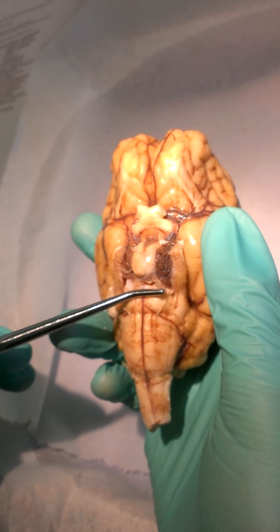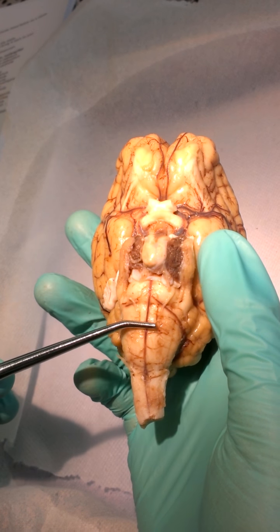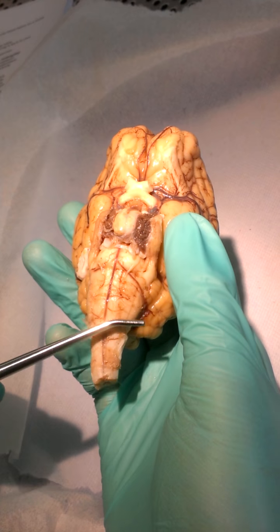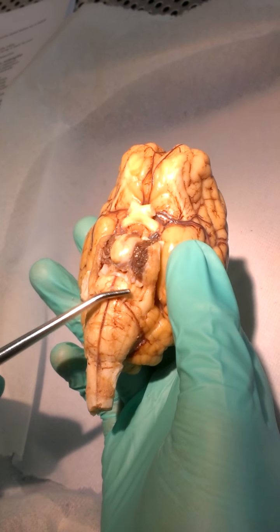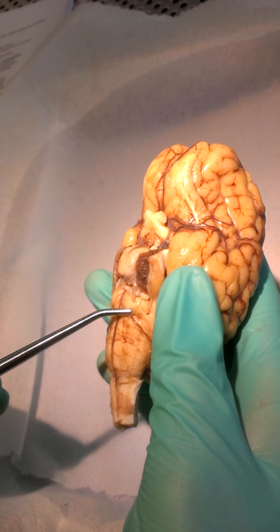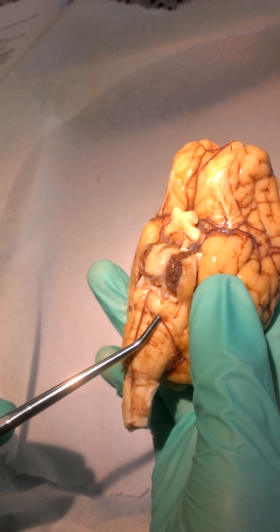So there you go. And then right here, you think this is the spinal cord, but this is actually the medulla oblongata, which leads to the spinal cord, which would be this little part down here. So medulla oblongata, the thicker part. And then down here, this is your spinal cord. And then you've got your pons. And then you've got these little strands. You might have to take a closer look, because I don't want to break them. See this little white track I'm running along?